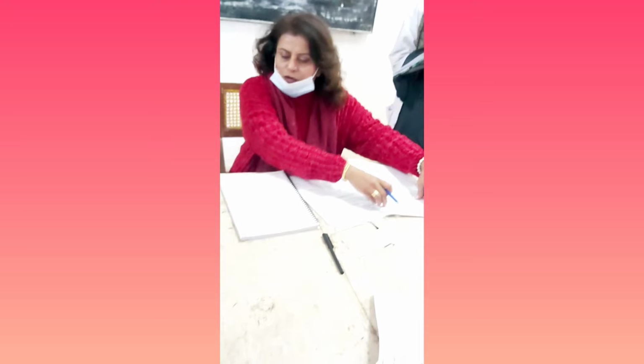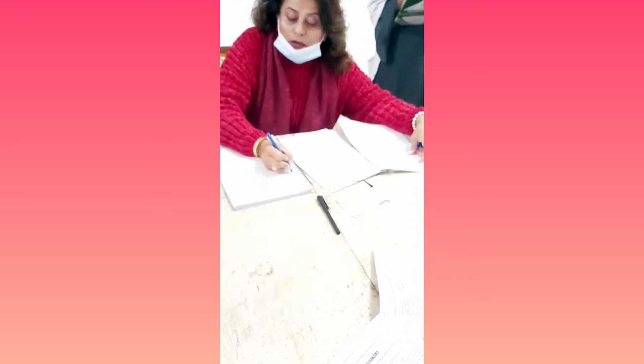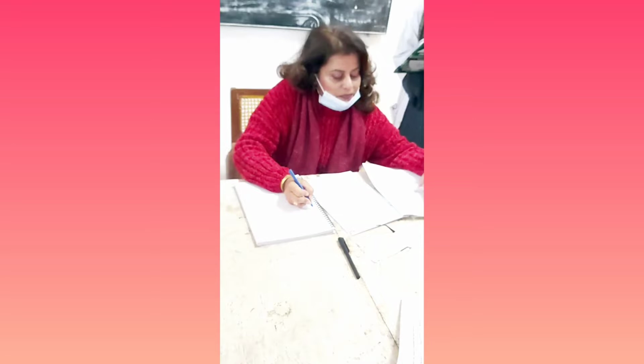You are not going to write this introduction here. You are simply going to write the object, then the glassware you are going to use, and then the preparation of some extract we are going to prepare today. Now, what is this extract? It is called sodium extract or Lassaigne's filtrate, or sodium fusion. It's a sodium fusion test. Now, what does that mean? That sodium has to do something with this test.